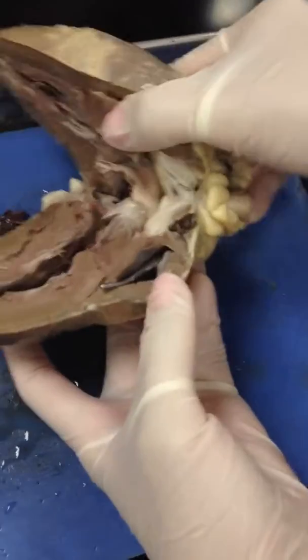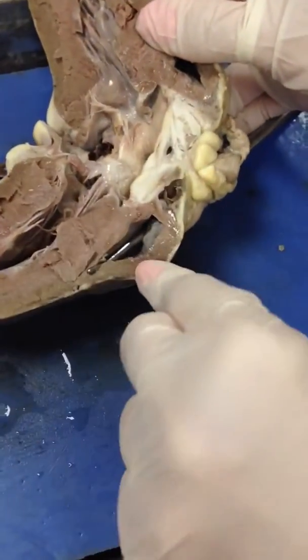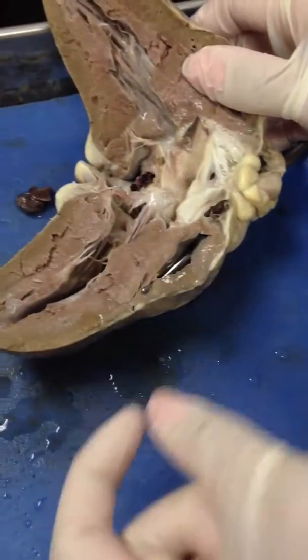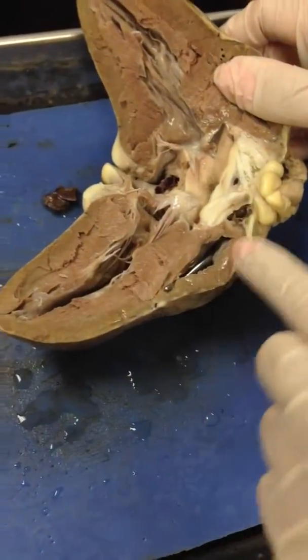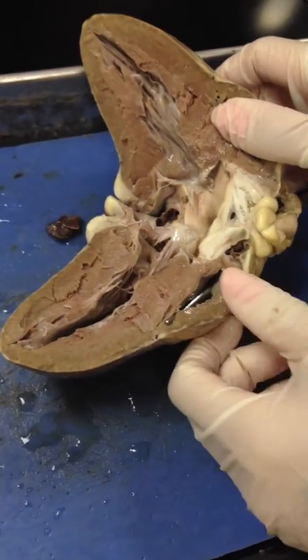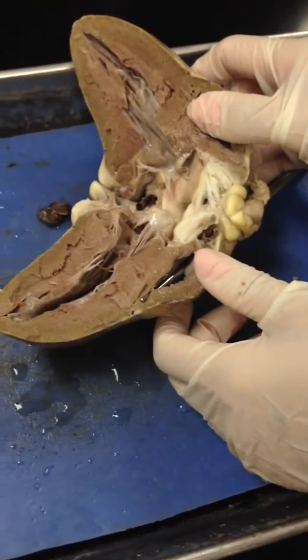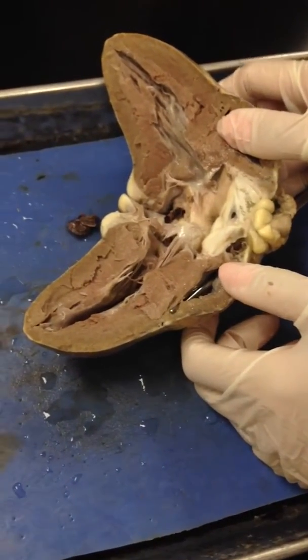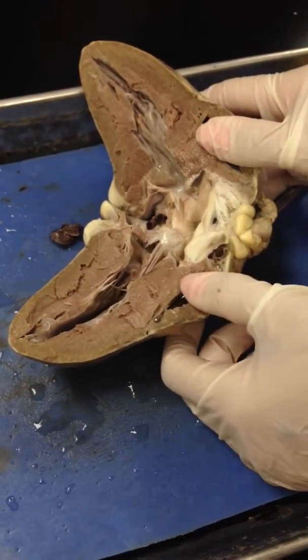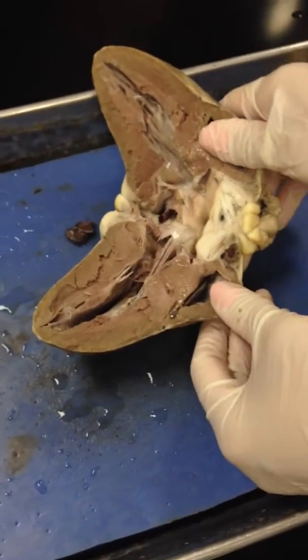Yes. So right ventricle is where it came from. Do you guys see — left has a thicker myocardium, right has a thinner myocardium. So we're looking at the right ventricle here. It might be a fatty heart — it's hard to tell. So what chamber is this? The ventricle. Which ventricle? Right ventricle. Is that oxygenated or deoxygenated blood? Deoxygenated blood.